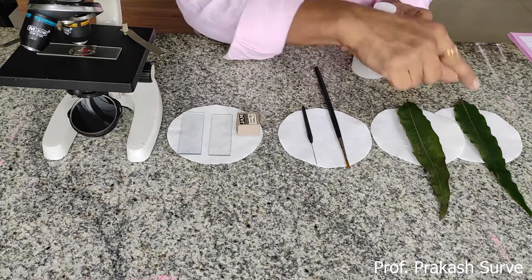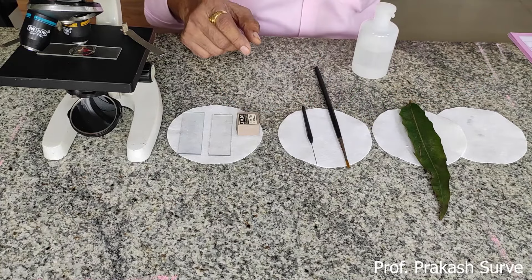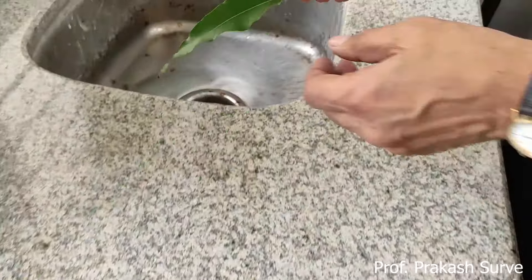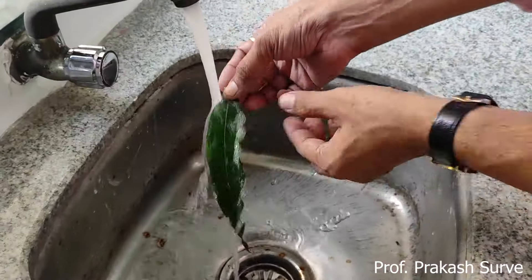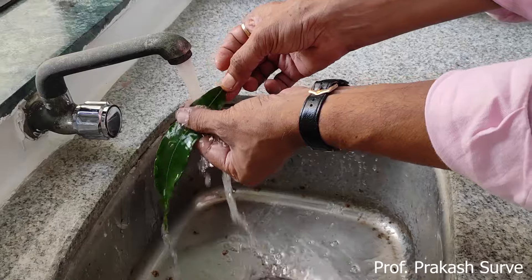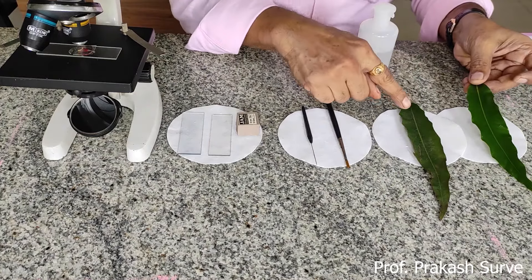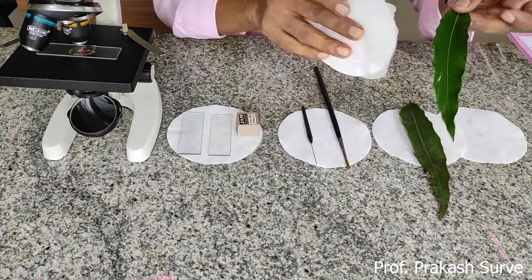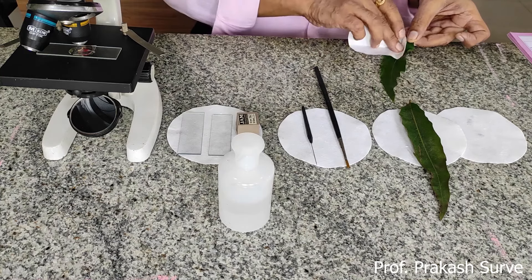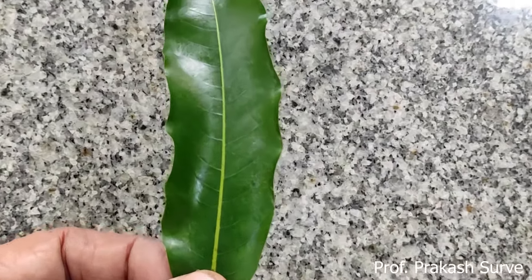The washed leaf needs to be cleaned under tap water so that all the dirt and particulate matter present on the leaf gets washed away. I am taking the leaf under tap water so we can compare the particulate matter present on the two leaves. This washed leaf is now clean — there are no dust particles or particulate matter present on it.